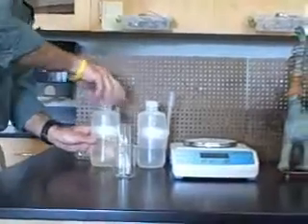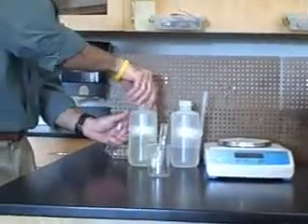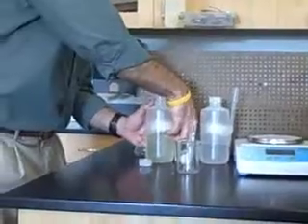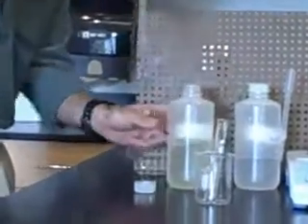I need somebody to come up here to dispense liquid number one for me. Could that please be Matthew? This is a dropper, and the way this works is you press the bulb, and you're standing right in front of the camera. You press the bulb, and you put that in the liquid, and you let go of the bulb.